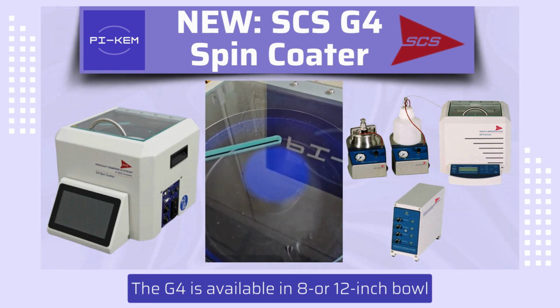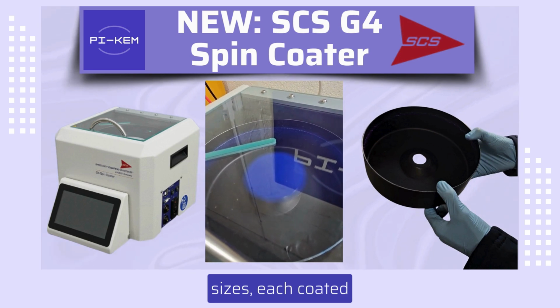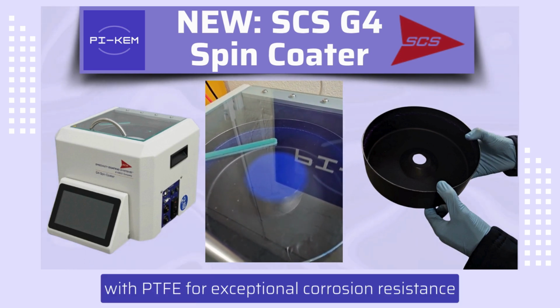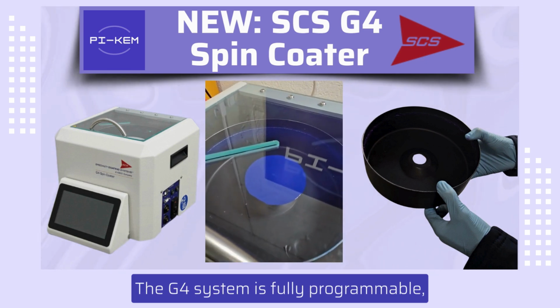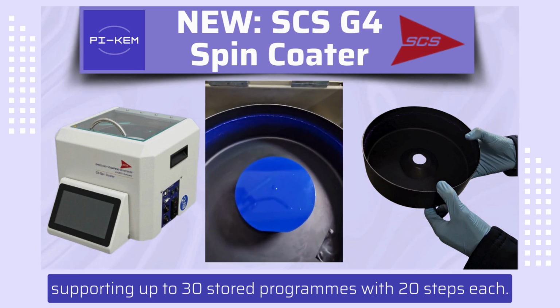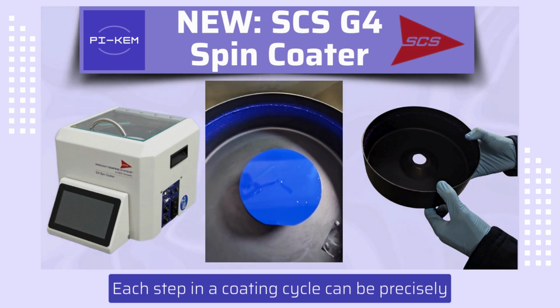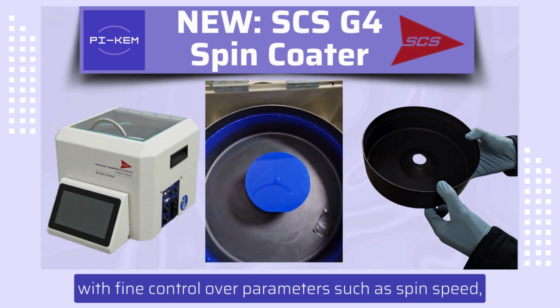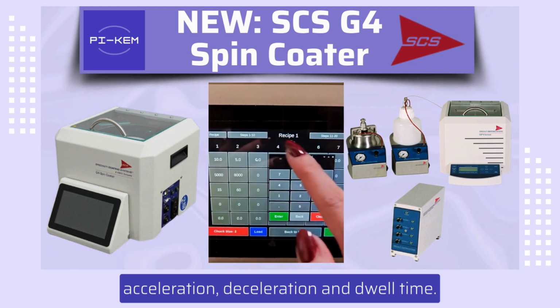The G4 is available in 8 or 12-inch bowl sizes, each coated with PTFE for exceptional corrosion resistance against a wide range of coating materials. The G4 system is fully programmable, supporting up to 30 stored programs with 20 steps each. Each step in a coating cycle can be precisely defined, with fine control over parameters such as spin speed, acceleration, deceleration, and dwell time.